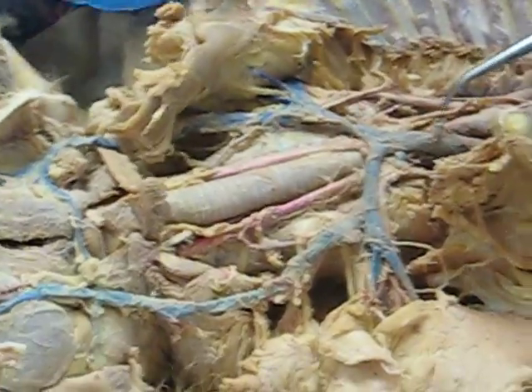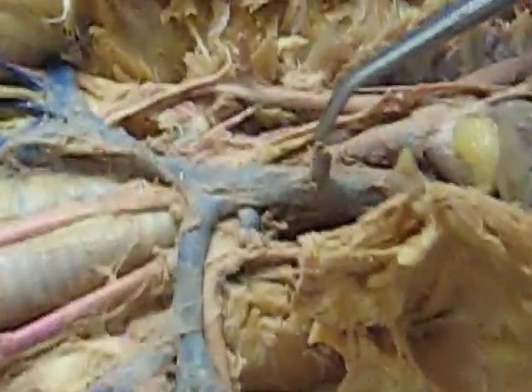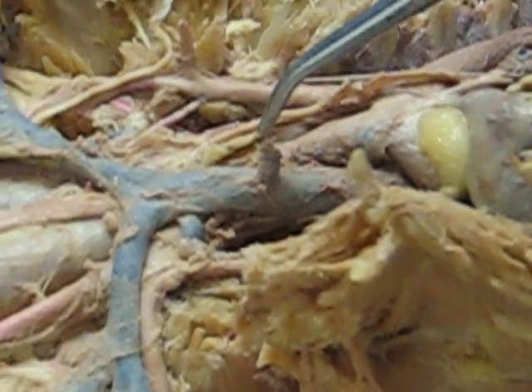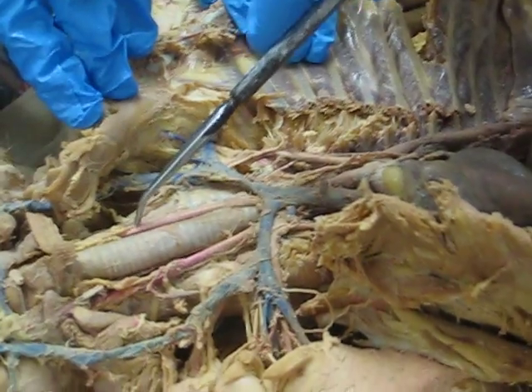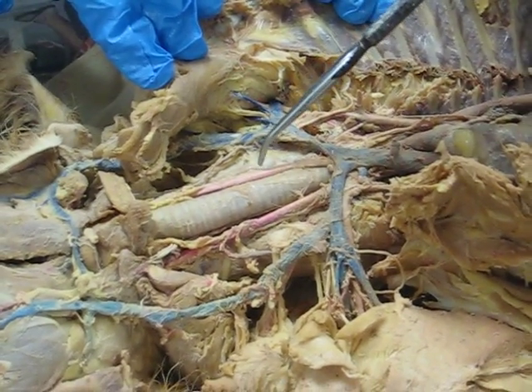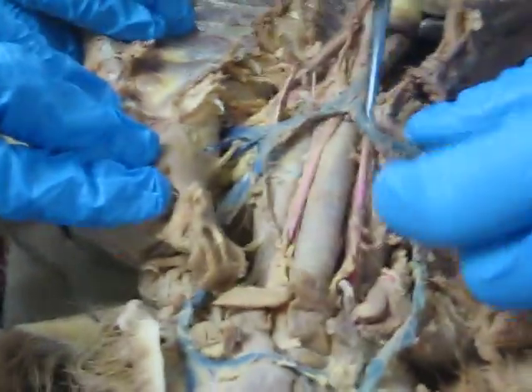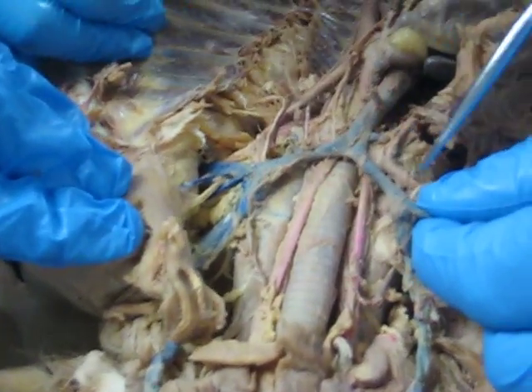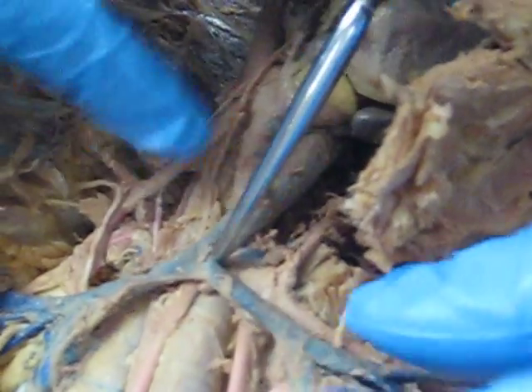After the superior vena cava you have this little nub right here, which is the internal thoracic vein. For the arteries, you've got the left carotid — common carotid right here — and the right common carotid. Underneath that we have the right subclavian artery, branching off the brachiocephalic.